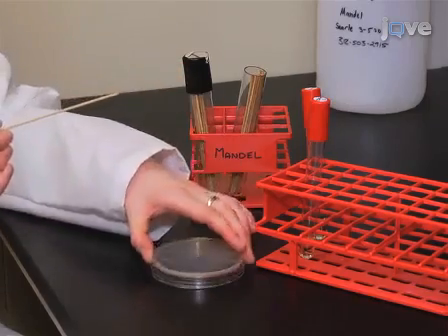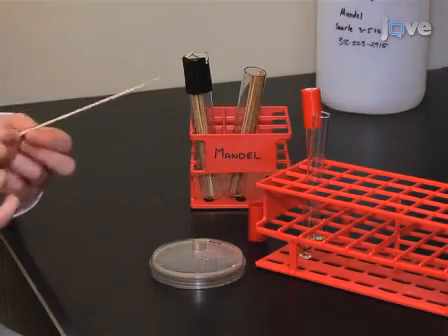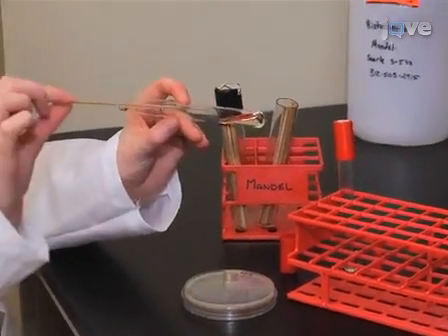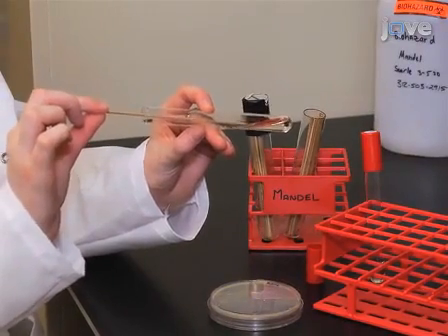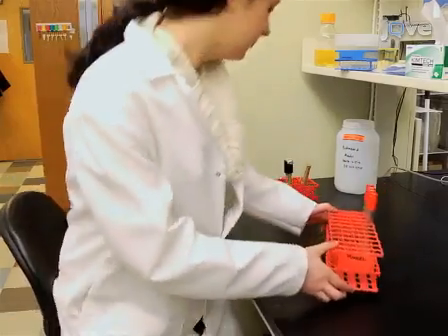The next day, for each strain under investigation, inoculate 3 milliliters of LBS medium in a glass culture tube with one colony of each Vibrio fischeri strain for infection. Prepare duplicate tubes as a backup.